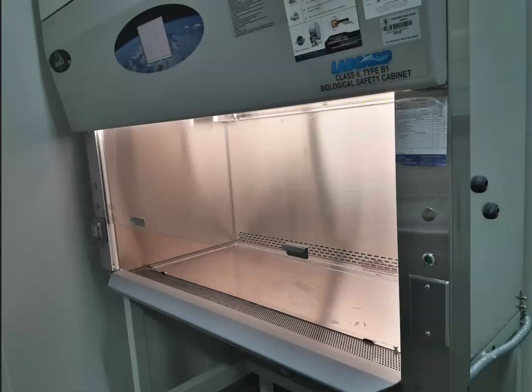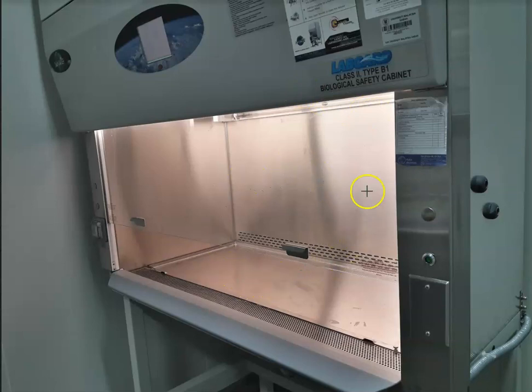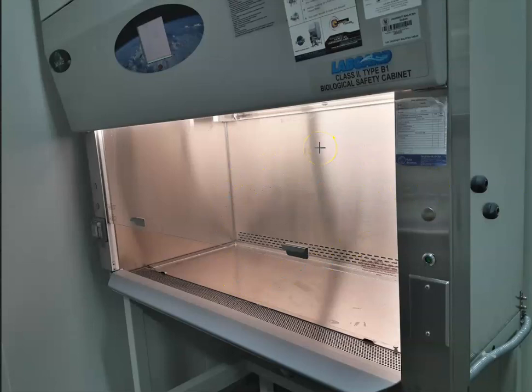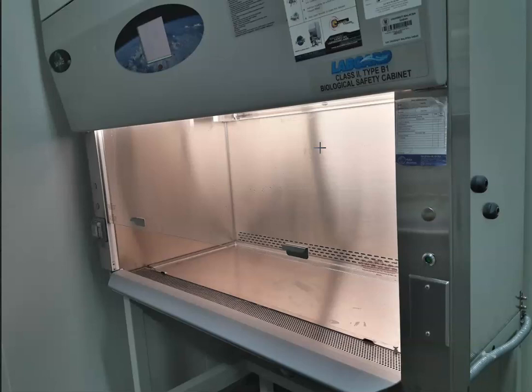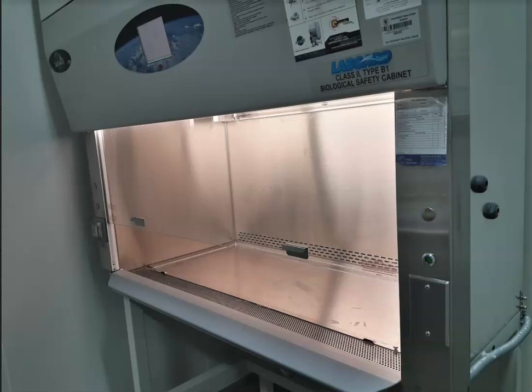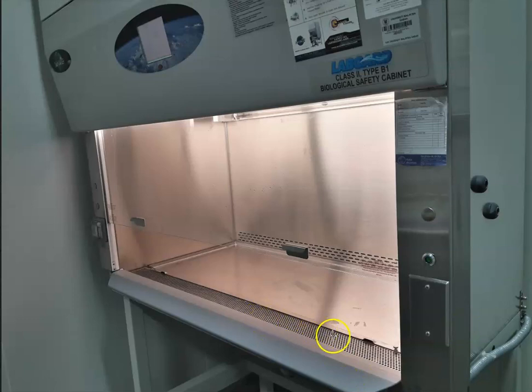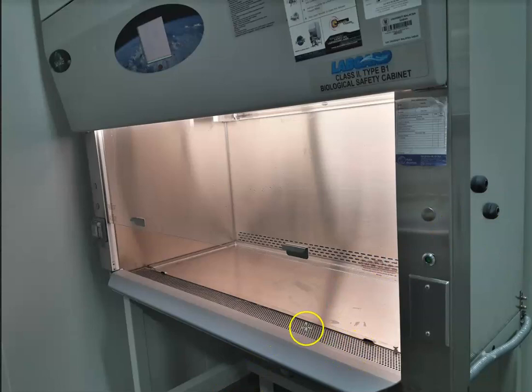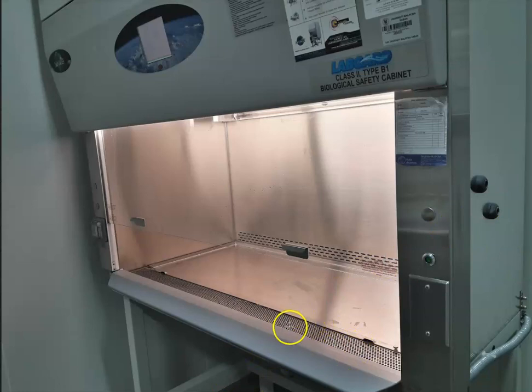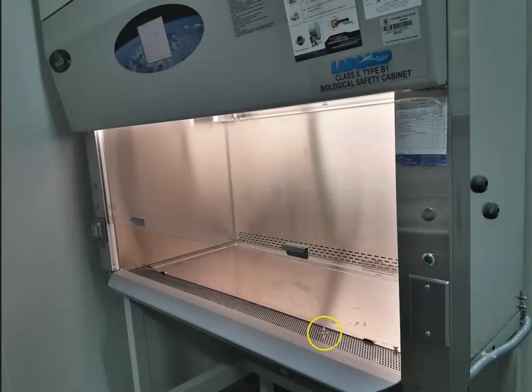Most biological safety cabinets are vented out into the environment, which means that the air from this cabinet is filtered prior to release into the environment. You have to ensure that no objects block this airflow at the front grill when working with this biological safety cabinet.